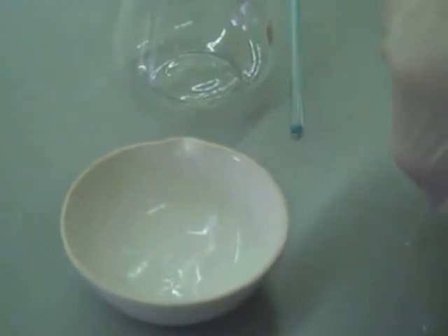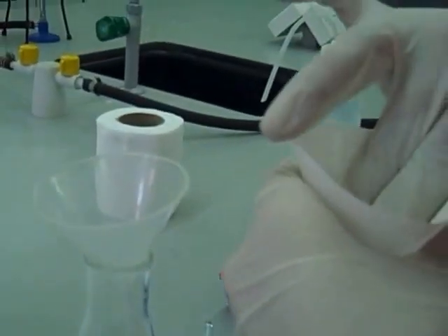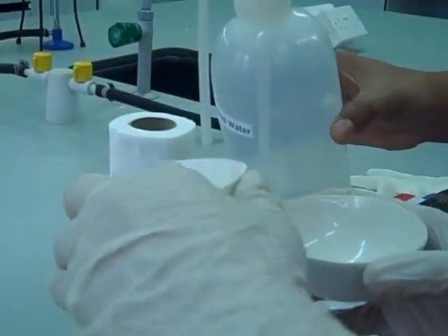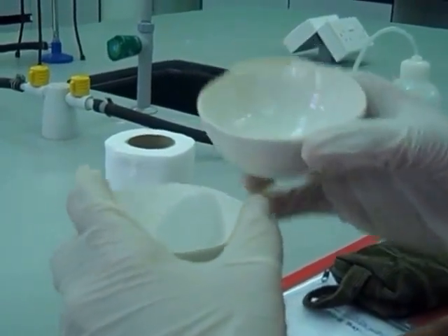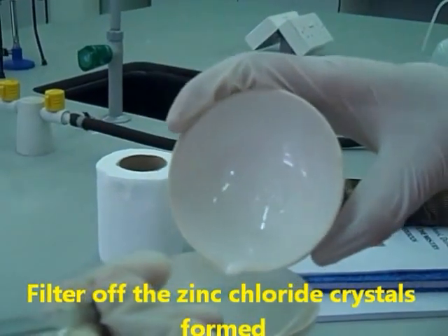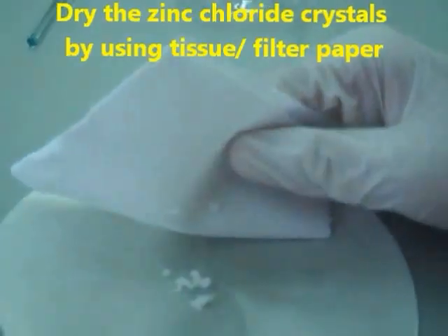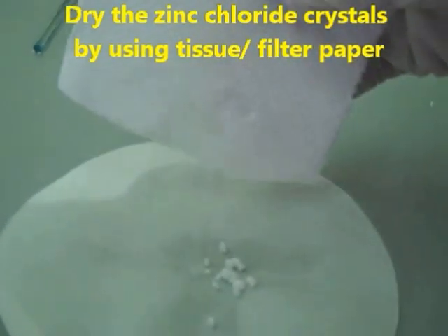Now we use the filter paper and the funnel to filter the crystals. Then we dry the salt between the folds of the filter paper. And that is the final stage.